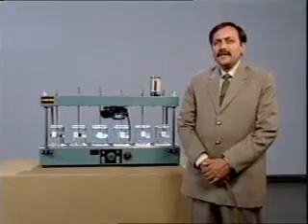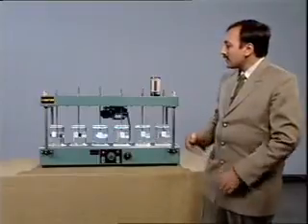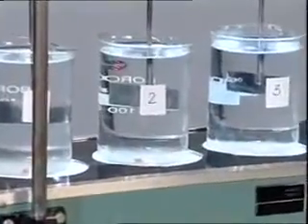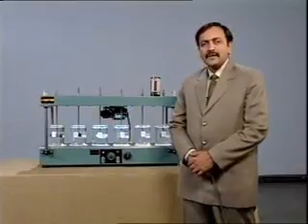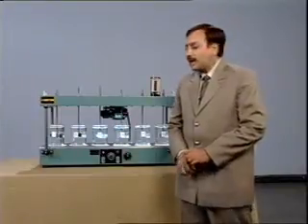In this case, the maximum turbidity removal with the minimum dose is observed in beaker number 2. Therefore, we can say that the optimum dose of coagulant is the dose added in beaker number 2, that is 10 ml per liter of water.